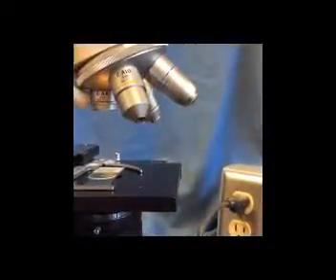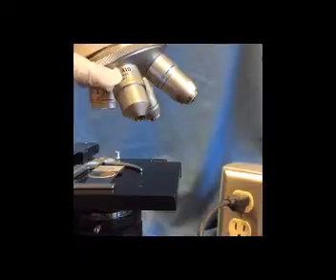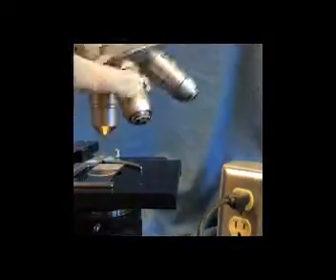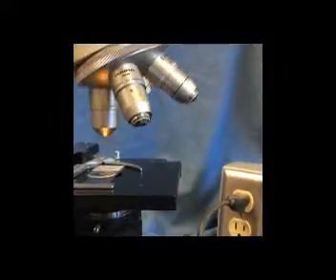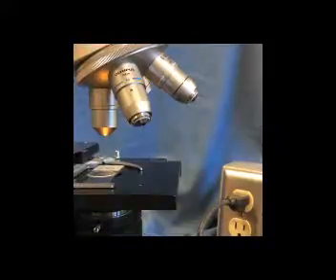Now we have really important rules with regard to which focus adjustment knobs we use with which objectives. So our rules are, we only use coarse focus adjustment with the least powerful, shortest objective lenses. So we use coarse focus only with our 4x scanning lens and our 10x low power lens, because the more powerful high dry 40x lens and oil immersion lens are so long, we're almost working with the lens touching our glass microscope slide.